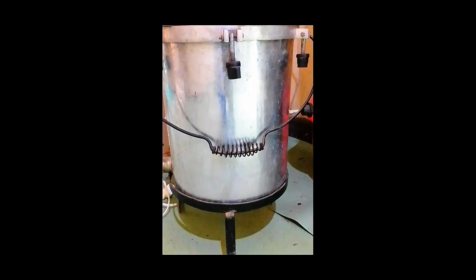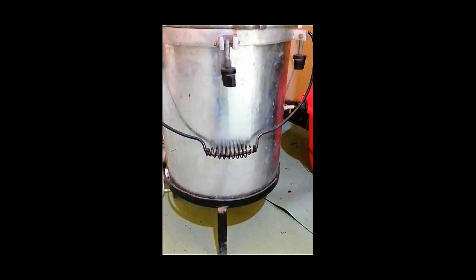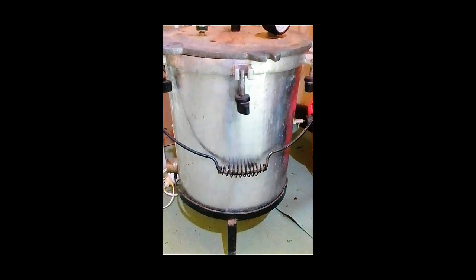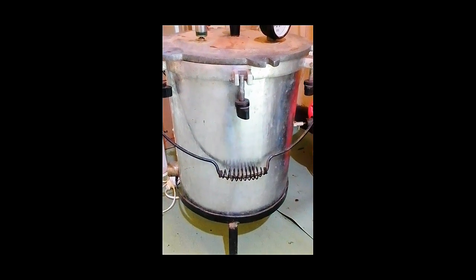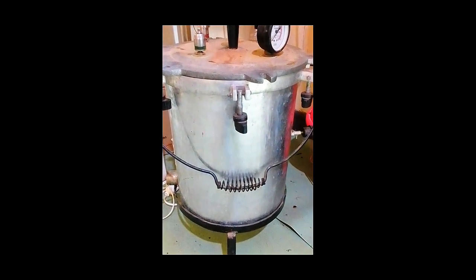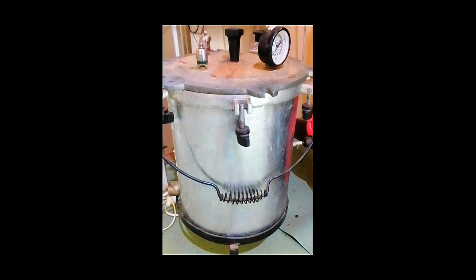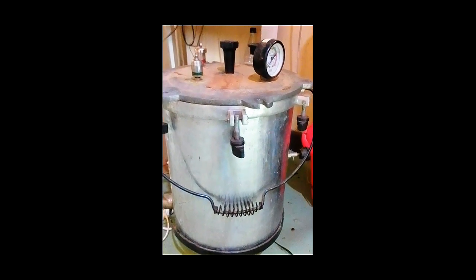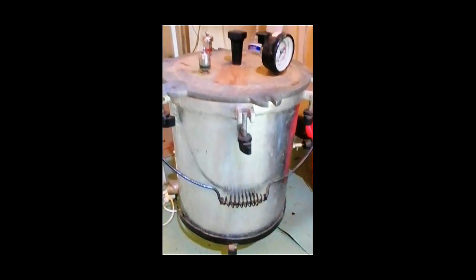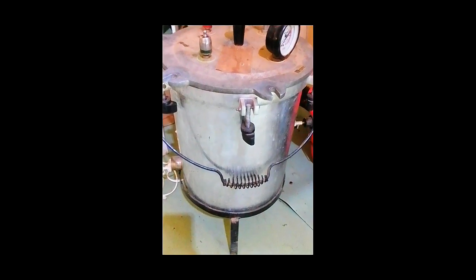1. Sterilization of laboratory instruments. One of the most important uses of an autoclave is the sterilization of laboratory instruments. Forceps, scissors, metal tools, and reusable equipment are sterilized before use to prevent contamination and ensure patient safety. 2. Sterilization of culture media. Autoclaves are used to sterilize culture media before microorganisms are cultured. This ensures that only the intended microorganisms grow, leading to accurate laboratory results.